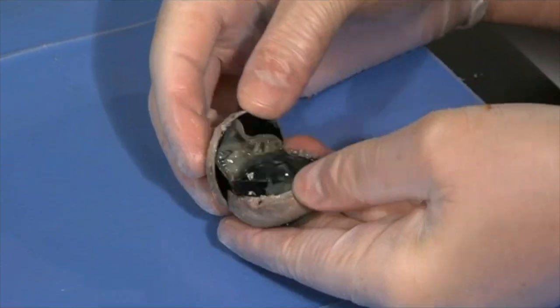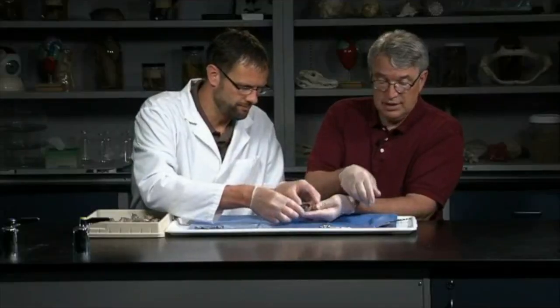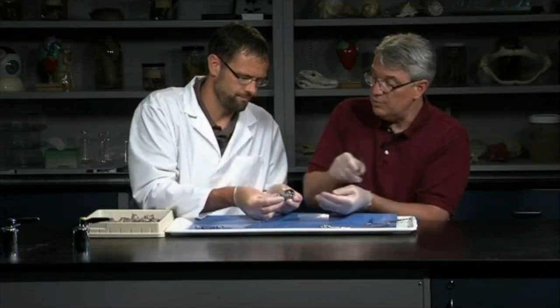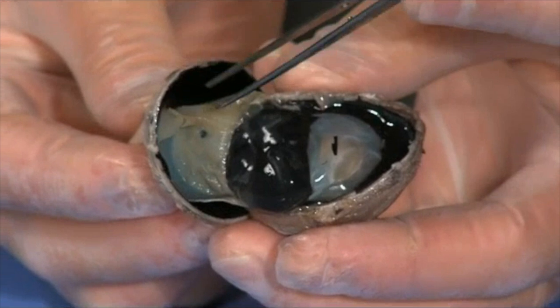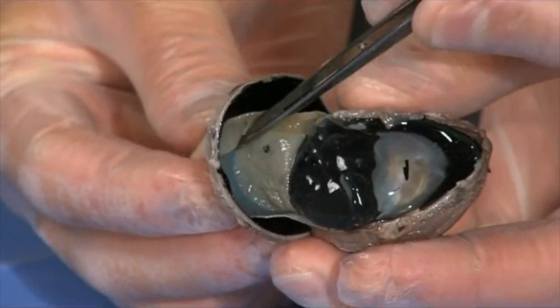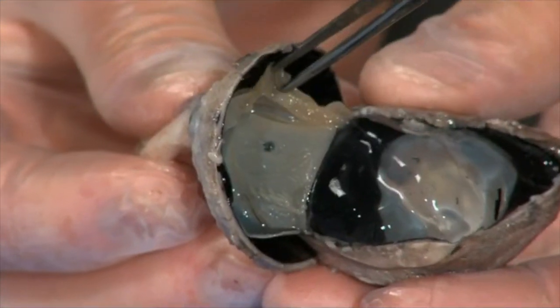Anyway, so here things are, and if you cut the eye, then you just open it up. I can hold it here for you. Okay, just open that up like that. I think maybe I'll use a pair of forceps here. And first of all, if you look here, you see this kind of translucent, almost flesh-colored layer. You notice that's against the back of the eye.